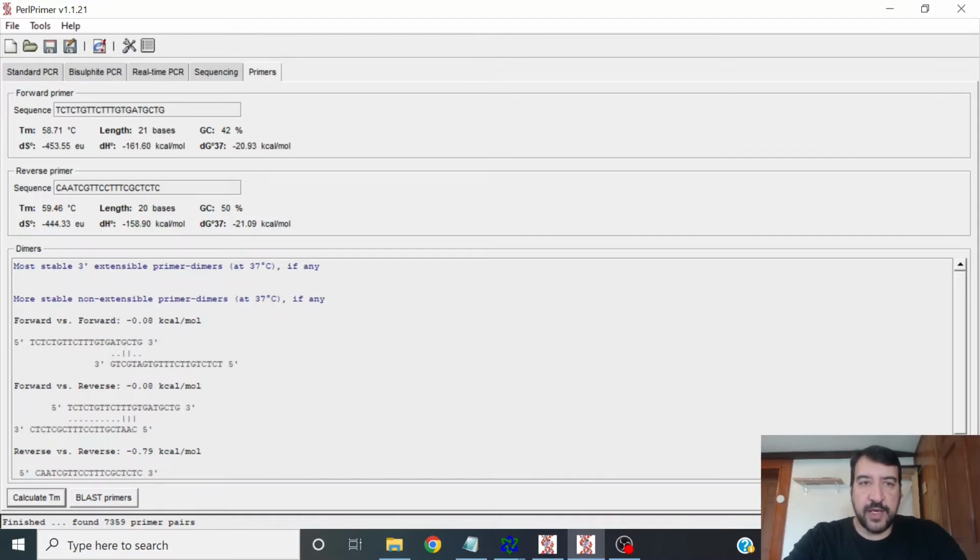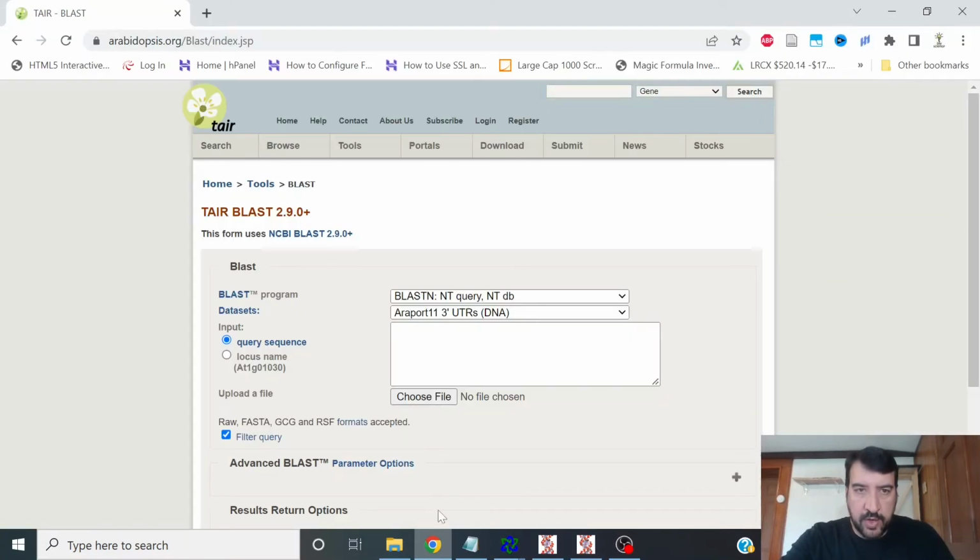The next thing we have to do is we need to blast our primers. We need to blast them against whatever genome we're working with to see whether these primers are somewhat unique or completely unique in the genome. We don't want to pick a primer that has many places to bind in the genome. I'll take this first primer here, and this is from Arabidopsis. So I'm going to go over to TAIR to blast it. You can go to whatever is your best resource for blasting your particular organism.